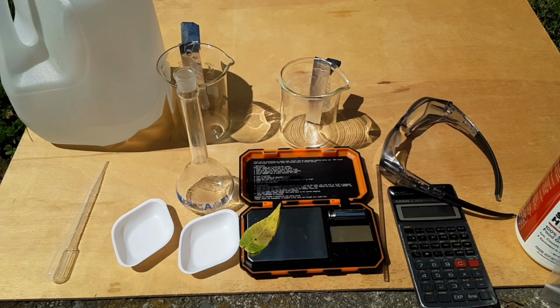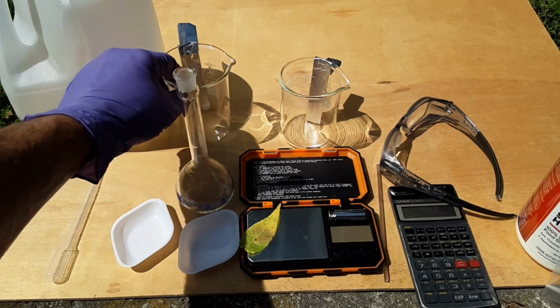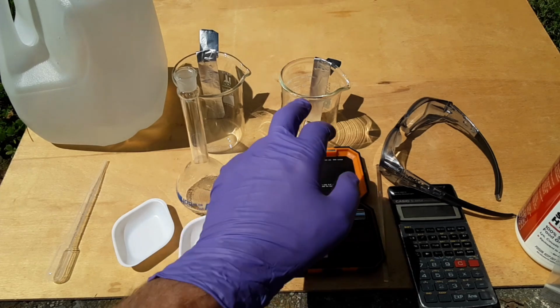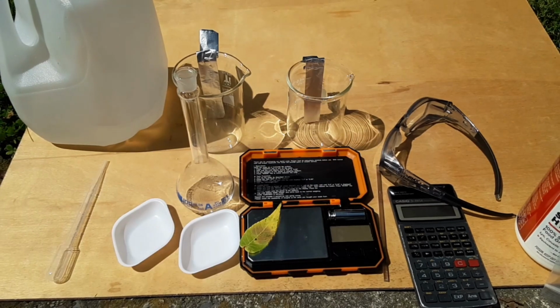I kind of already know the results to this ahead of time, I think, but we're just going to try it anyway. In the case of the sodium hydroxide, when I initially looked that up, they said that's an example of a displacement reaction. And then I looked it up in another source and they said that's hydrolysis. So it definitely forms hydrogen gas, no doubt about that. Probably the other byproduct would be sodium aluminate. In the case of the potassium hydroxide, I would assume it would be potassium aluminate.